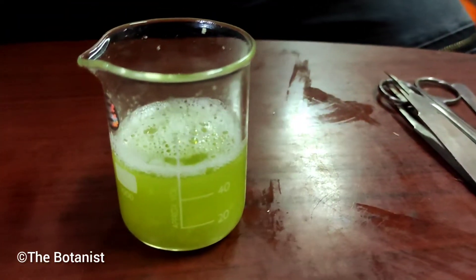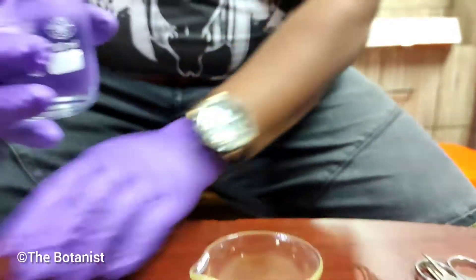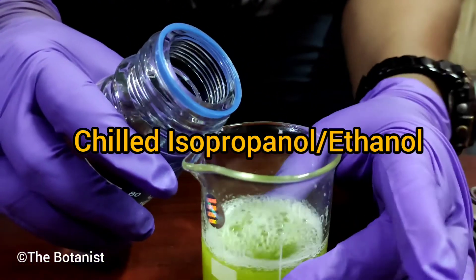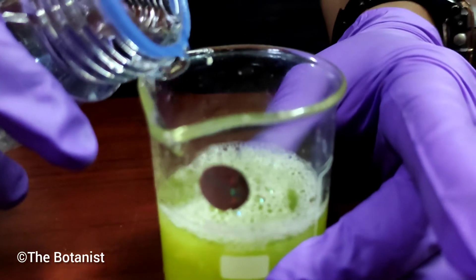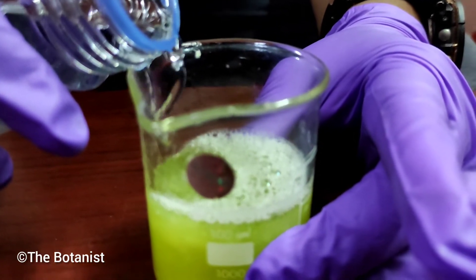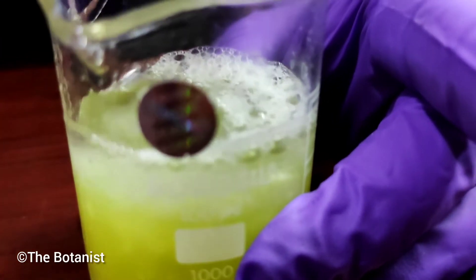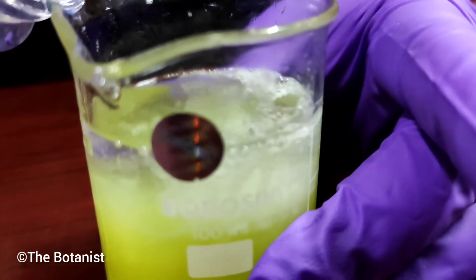This is the filtrate. Now we are going to add chilled isopropanol into this solution. This is a less polar solution — the isopropyl alcohol sits on top of the mixture containing salt water, soap, and cells.